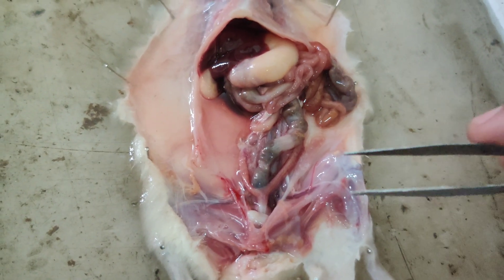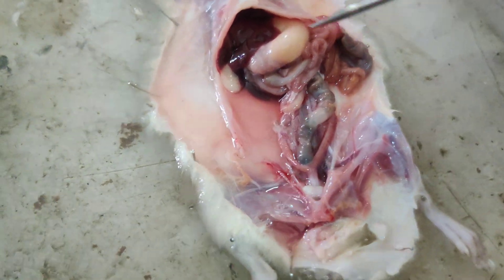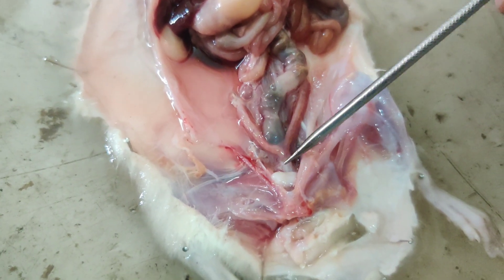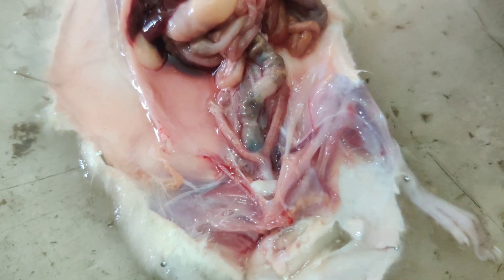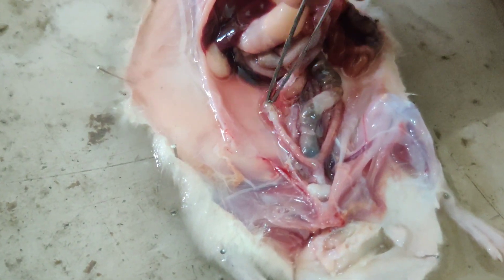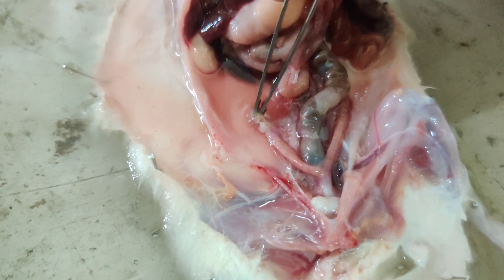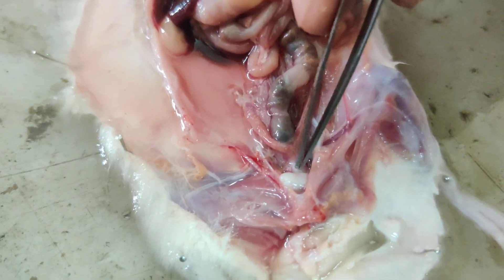Now you can see the reproductive system. Here you can see the uterus — this is the uterus. The uterus joins at this point, and this is the vagina. At the terminal part you can see a reddish dot-like structure — I am just holding this — this is the ovary. So we have the ovary, uterus, and vagina.